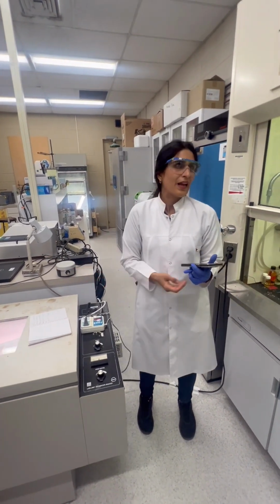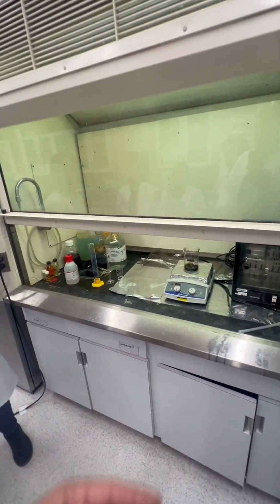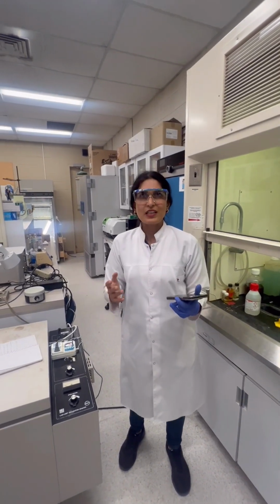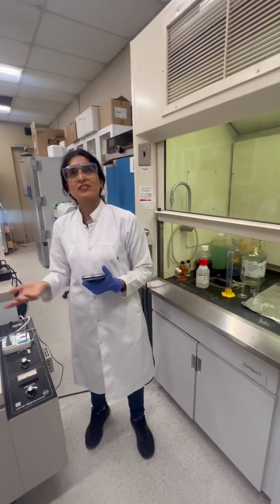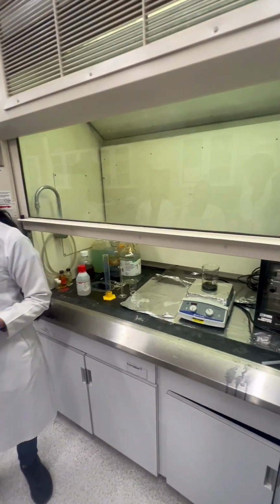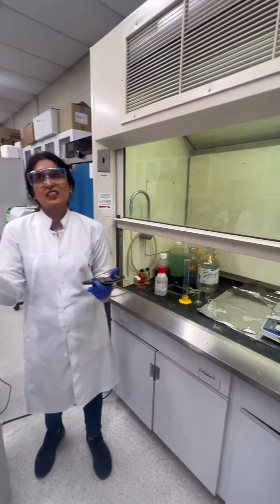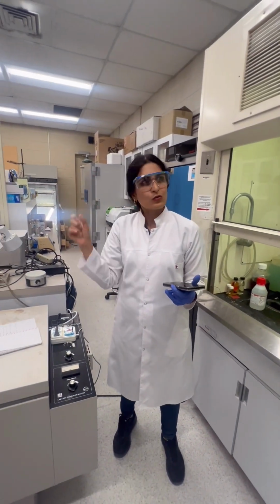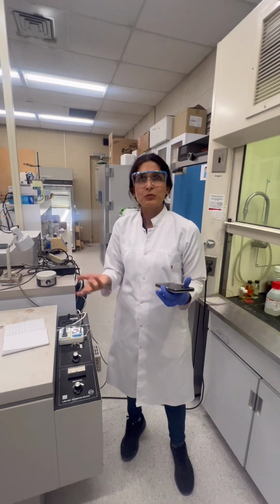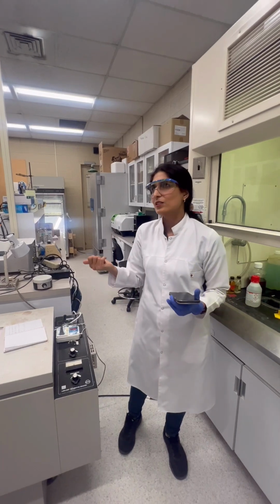And after that, we can mix it. Yeah, we can dope some elements. So we can dope at this stage? Or I just want to synthesize graphene oxide, but sometimes when we're going to modify, in my opinion, it's important to first synthesize graphene oxide. After that, we can modify it with some other nanoparticles. It's better to first characterize. Use the FTIR to see some functional groups of oxygen like carbonyl, like epoxy, and when we are sure we synthesized it well, we can proceed.